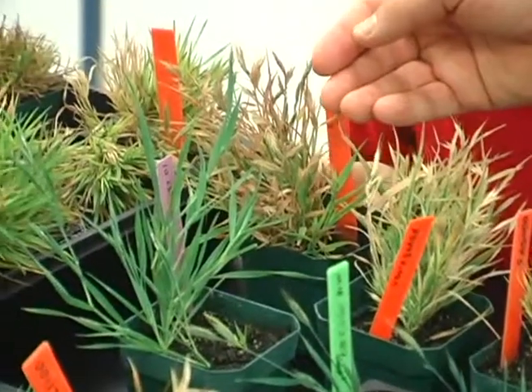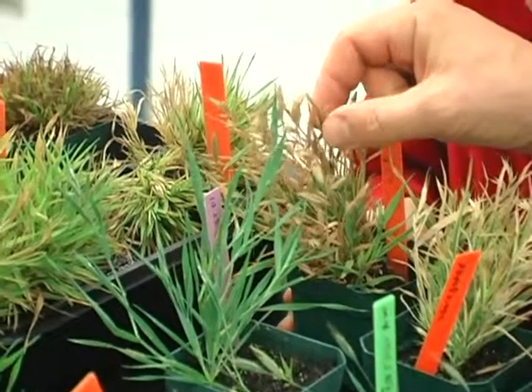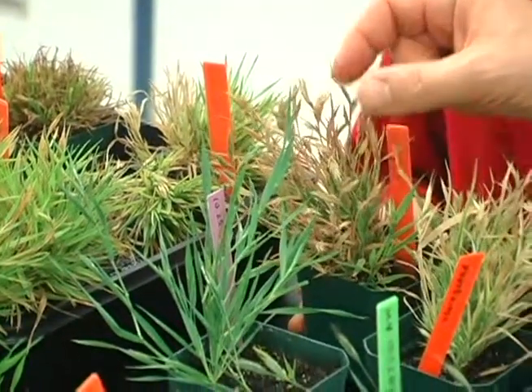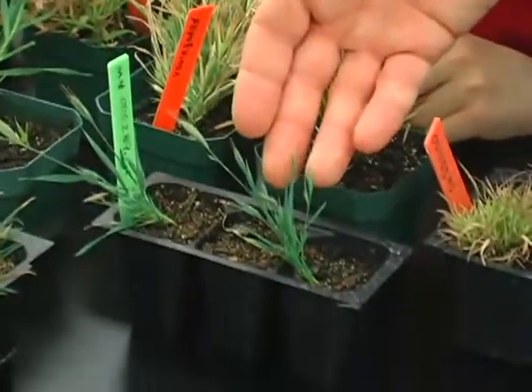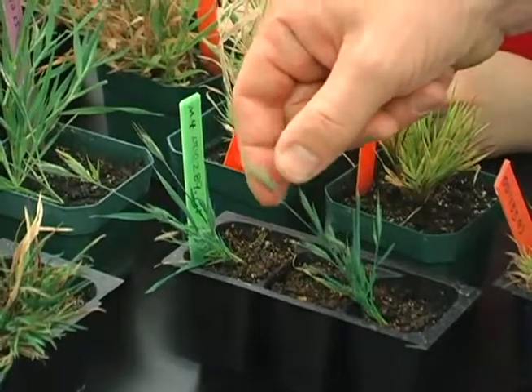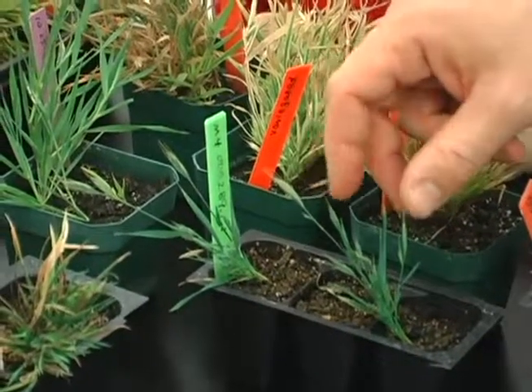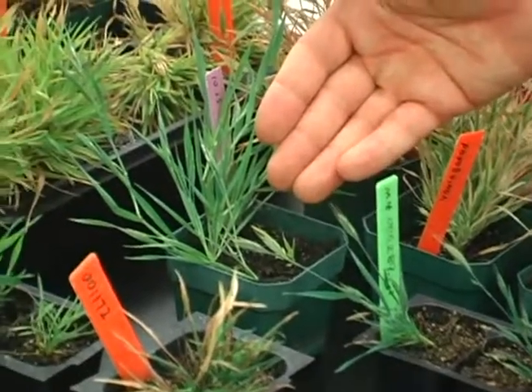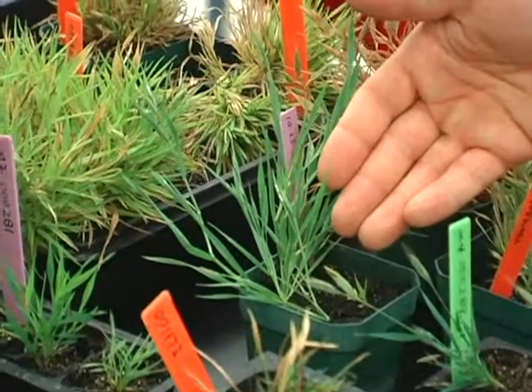This was an early flowering mutant that has now begun to senesce, and you can see that the spikelets are turning brown. This is another early flowering mutant that's at a slightly earlier stage in development. We don't see the senescence yet, but the plants are noticeably shorter than the wild type. And here's another branching mutant where the plant has produced multiple tillers or branches.